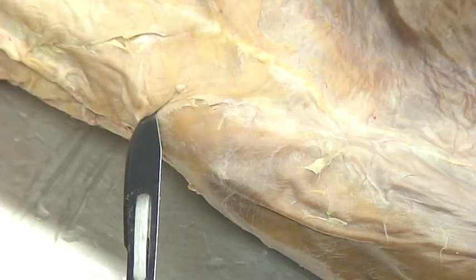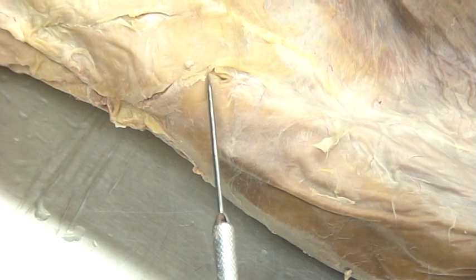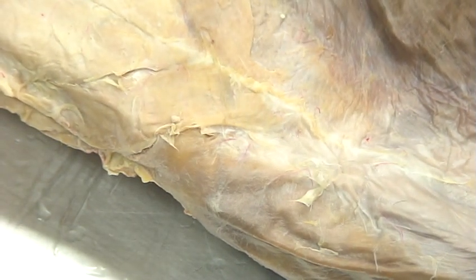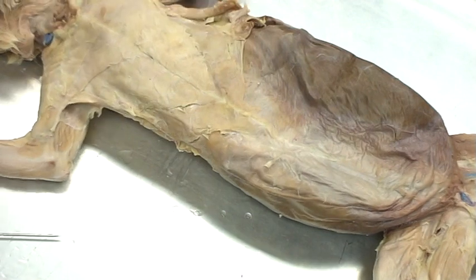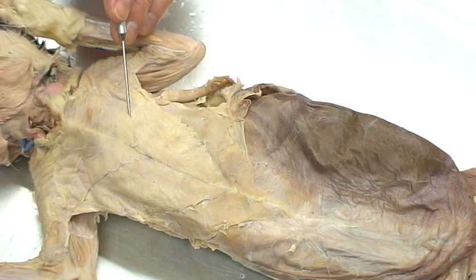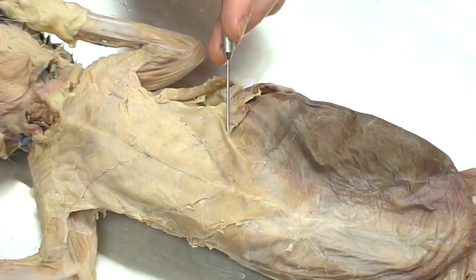You want to be really careful not to cut any of those muscles — I'm just separating. You can see I can work the blade of my scalpel, and this muscle actually lifts up and forms one continual sheet. If I zoom out, what I'll find is that the muscles are set up in packets of four. I'll move over to this side where I've pre-dissected some so you can see those layers a little bit better, and I can just lift that up so you can see some definition there.